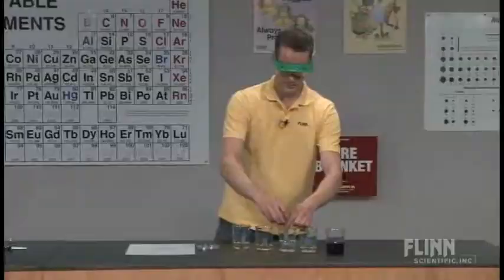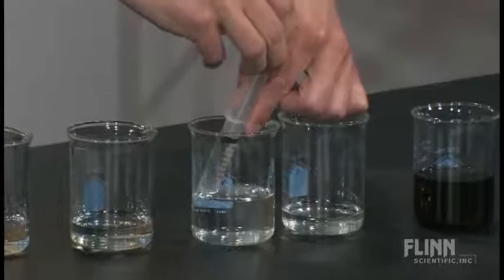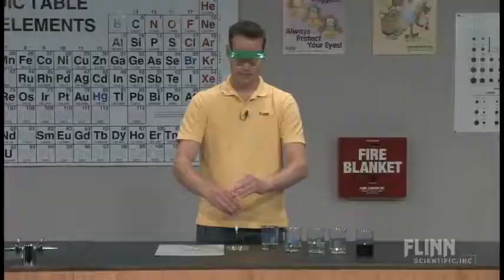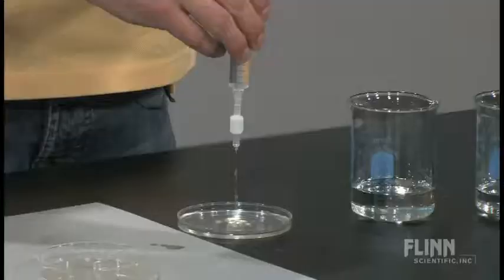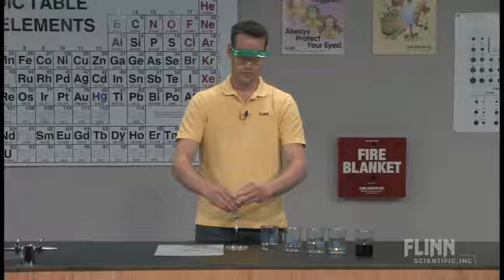So the next thing we're going to take is just water. The solvent that we've used to dissolve our Kool-Aid is water. So you want to prepare the column with something similar to what you're going to be pushing through the first time. Once they've pushed through the isopropyl alcohol and the water, the column is ready to use.